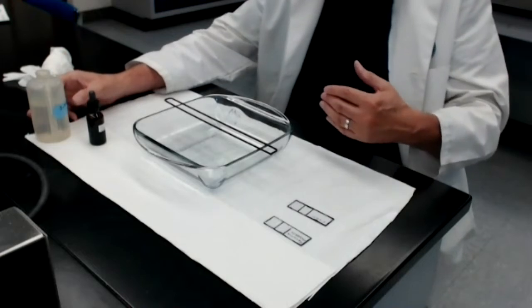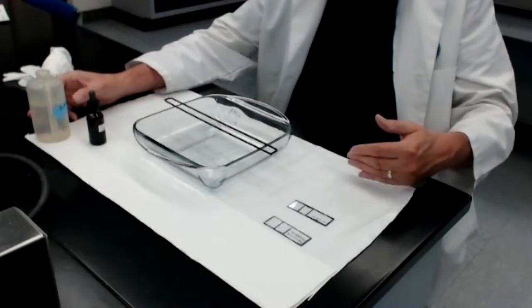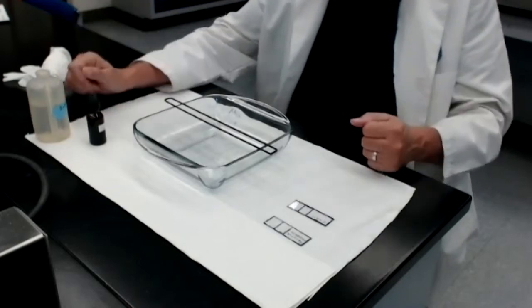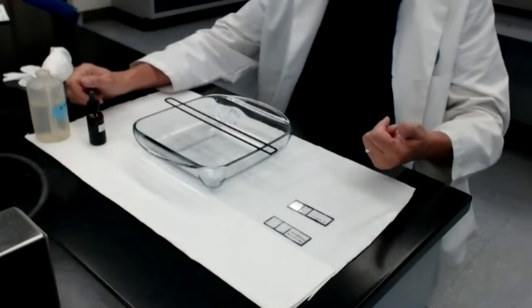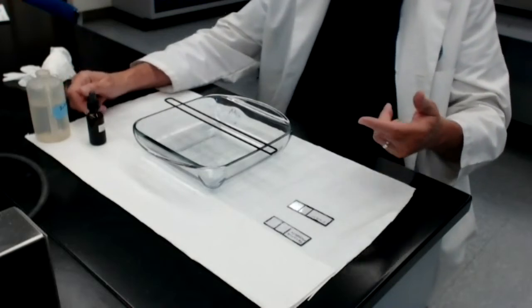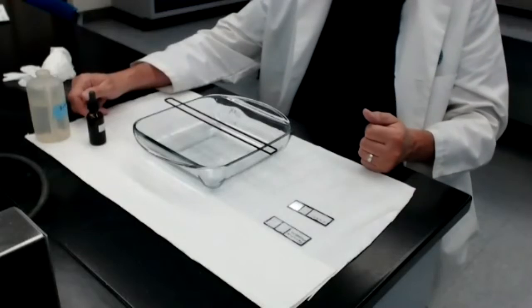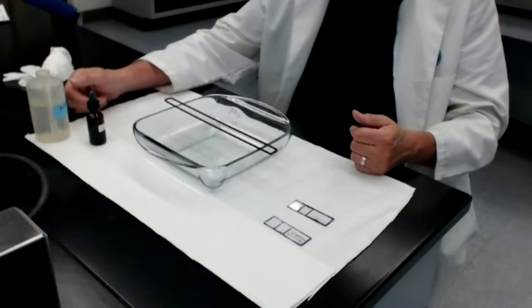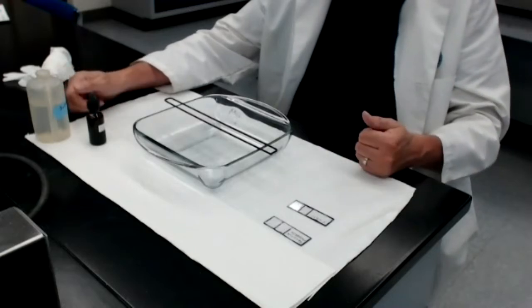The stains that we are doing in this class in modules 5, 6, 7, and 8 belong to the first three categories. Simple stain, which is module 5, differential stains, modules 6 and 7, which would be the Gram stain and the acid-fast stain, and then module 8, which is an endospore stain, which is a type of structural stain.